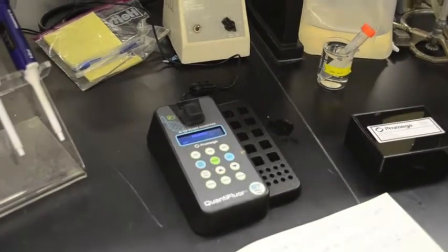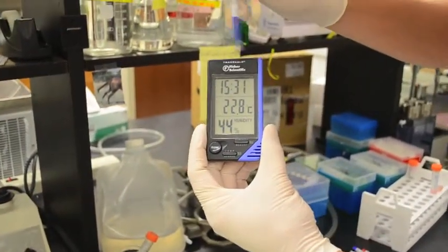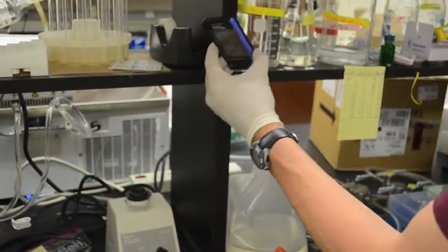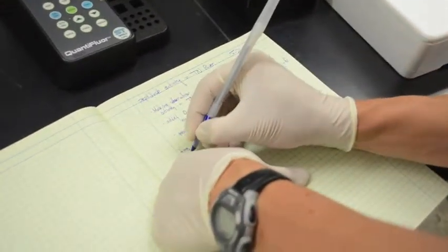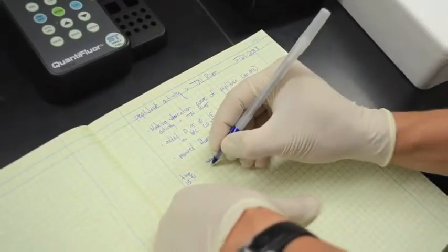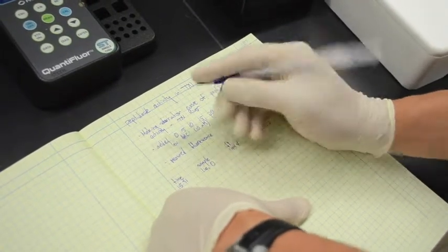Now when we do that, I've got a clock right here. It's got the time. I always use 24-hour time. So I'm going to record the time in hours and minutes along with the fluorescence value. So the time is 1531 and the fluorescence is 194.8, and the sample was the live 0 microliters sample.